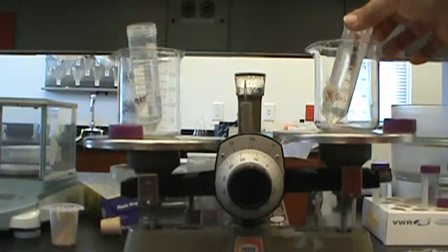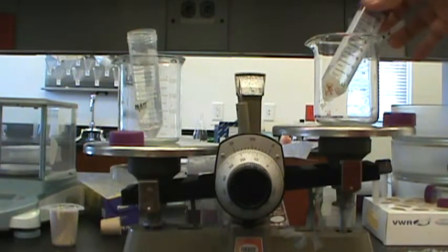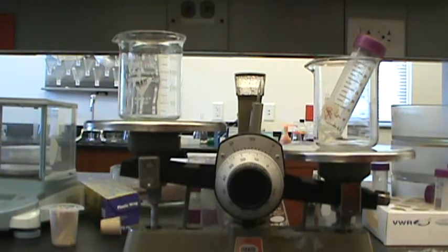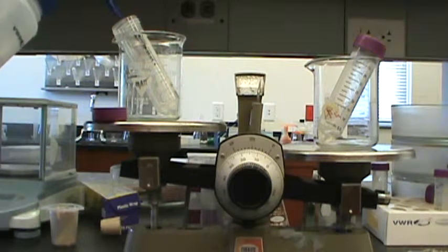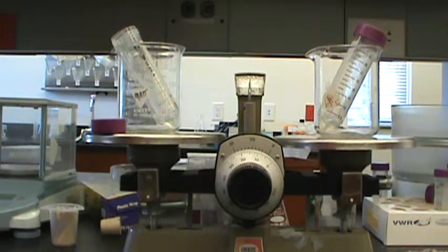There will be other situations where you will be using a material that you want to keep sterile. Because of that, you obviously do not want to open it out in the lab. In situations like that, what you do is simply take a tube that you are going to use as a blank, again with the lid, and use water to balance your tube. That way you do not have to open your sterile tube while you are balancing it.